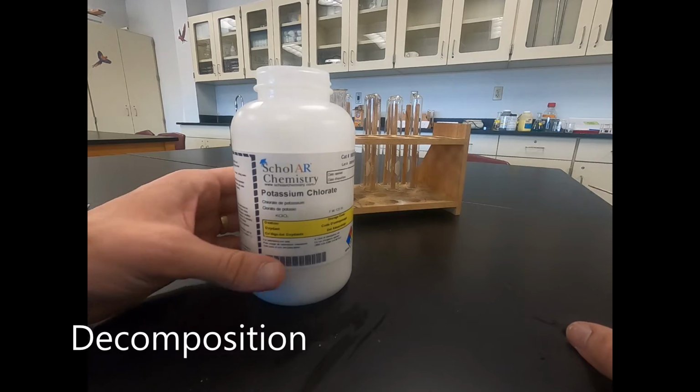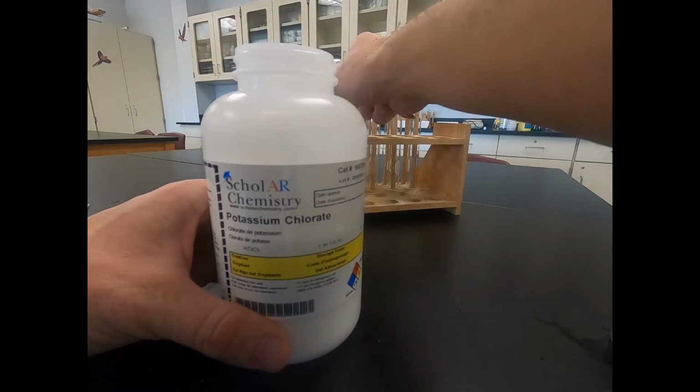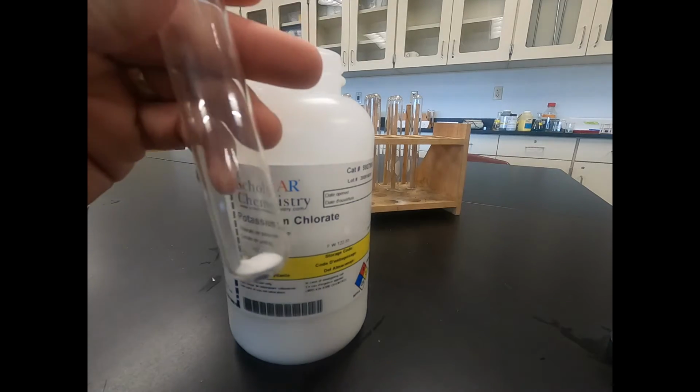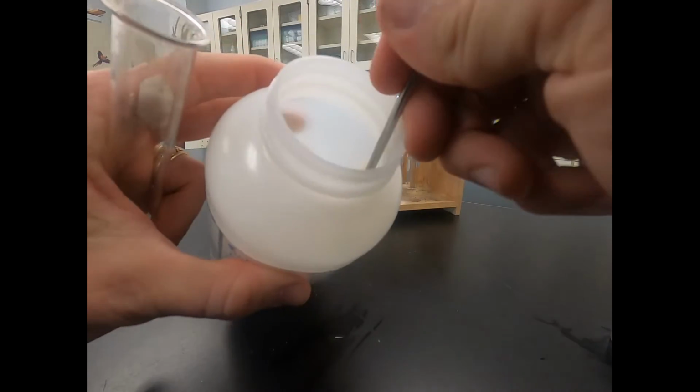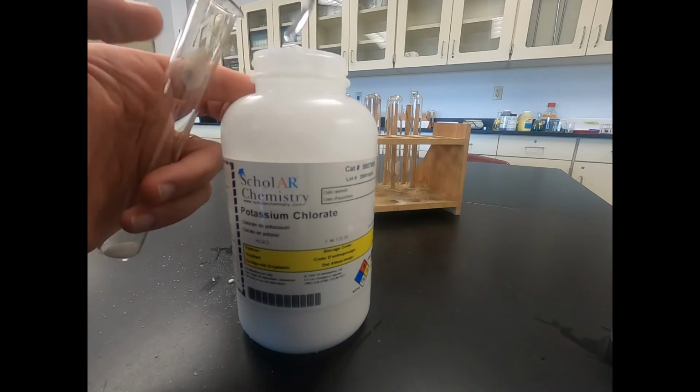For our fourth reaction, we're going to use potassium chlorate. It's a white powder, and we're going to put some of that white powder into a test tube. I've already started it. We'll add some more to it, and then we'll heat up the powder so it becomes a liquid.